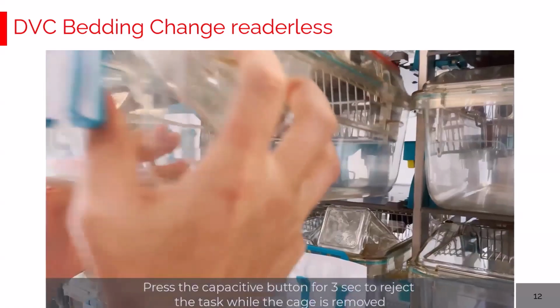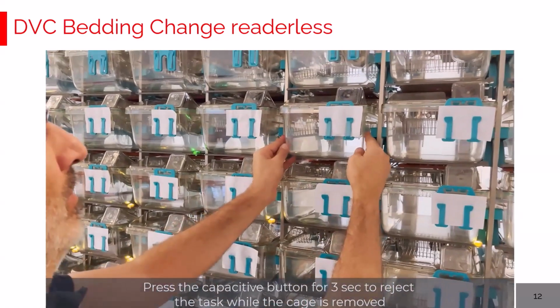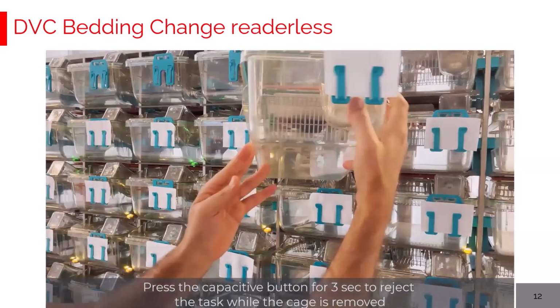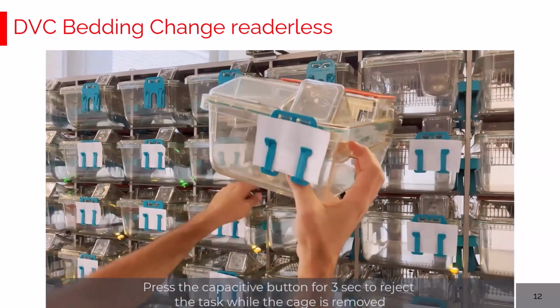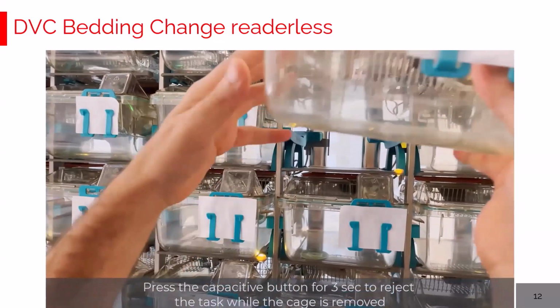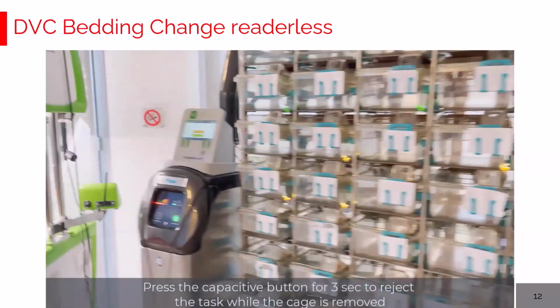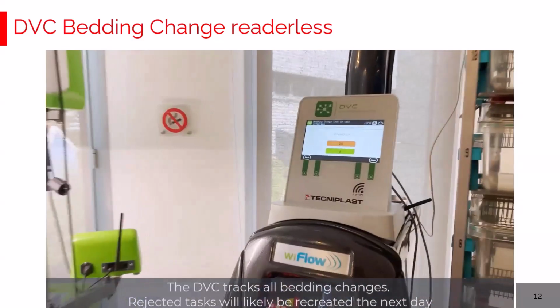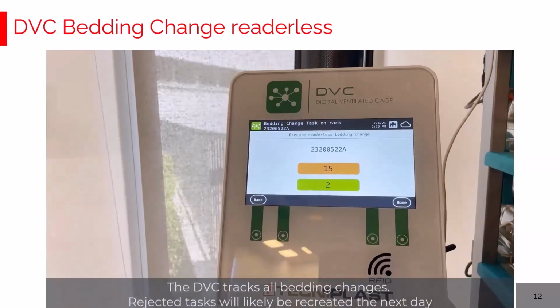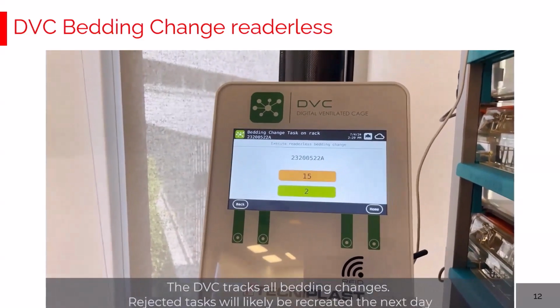In case a cage is not dirty enough and you want to skip the task, simply click and push the button to reject the task and move forward with the other dirty cages. Very, very simple. Whatever you do is tracked in the DVC system. Every time a bedding change is performed, it is tracked, showing you the remaining ones.